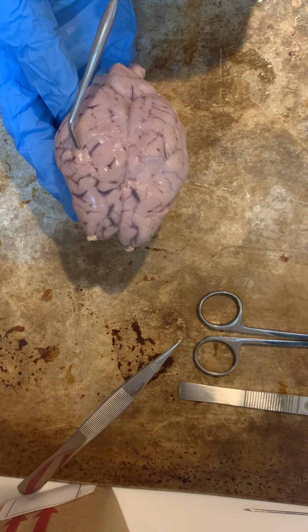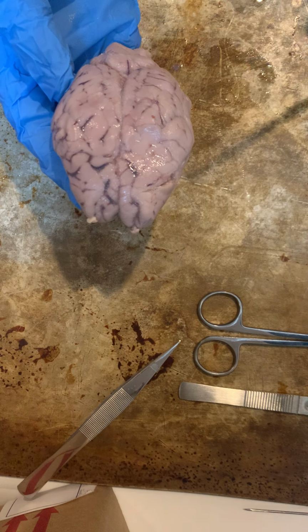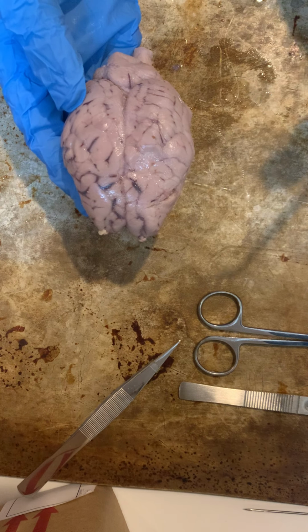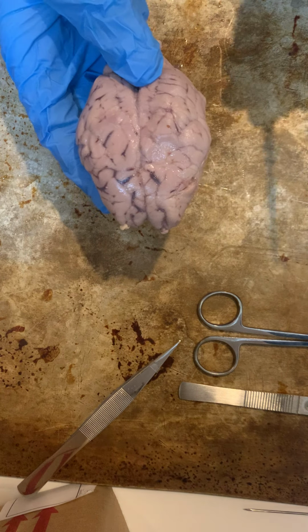And then next, we have the parietal lobe, which is just behind the frontal lobe. So here is our parietal lobe. The parietal lobe processes our body temperature, taste, and touch and movement. And touch includes where the movement is, the pressure of the movement, like the depth of the movement, and things like that.